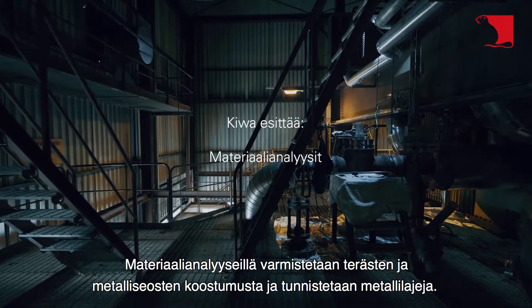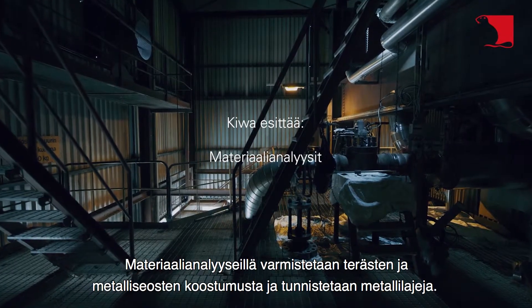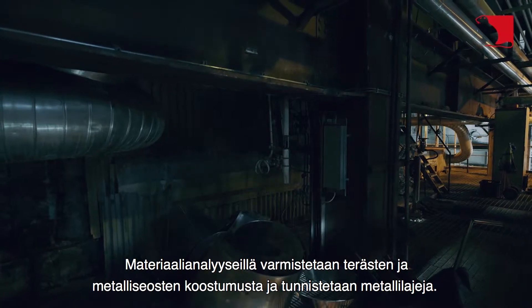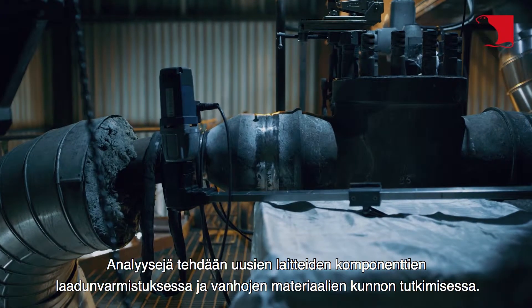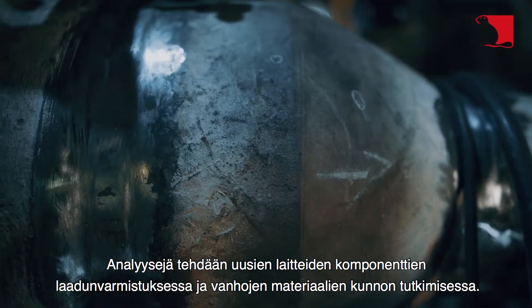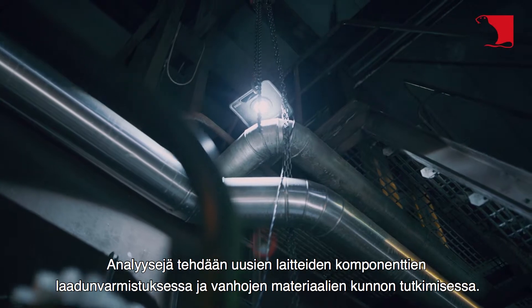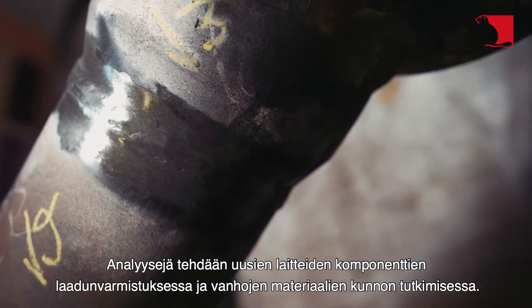Material analyses ensure the composition of steels and alloys and identify types of metal. Analyses are made in quality assurance of new equipment components and in the condition examination of old materials.